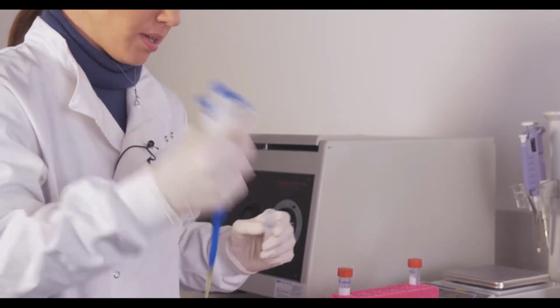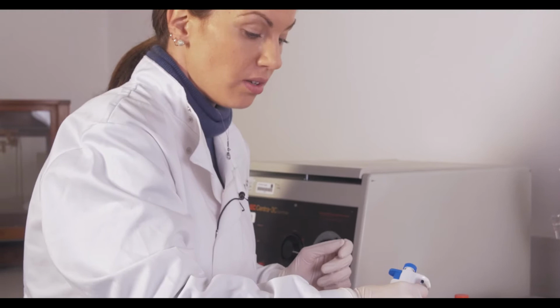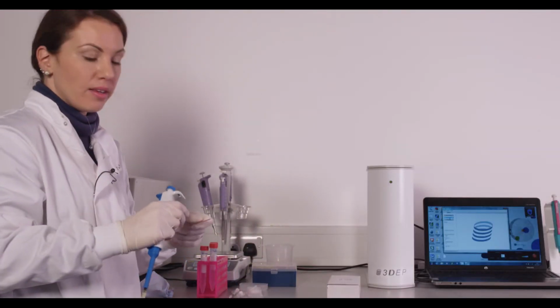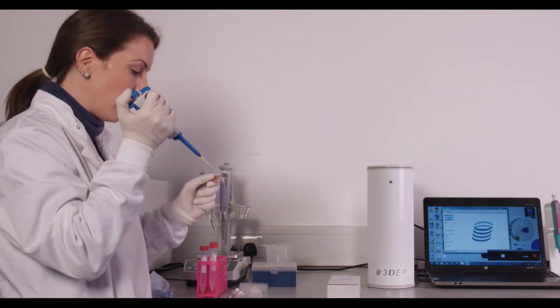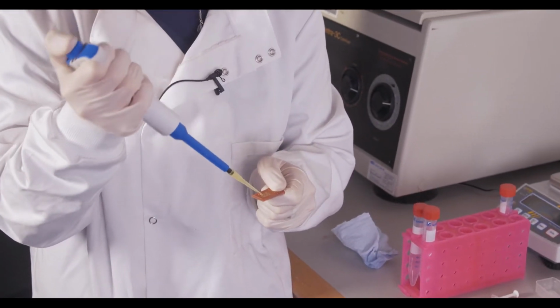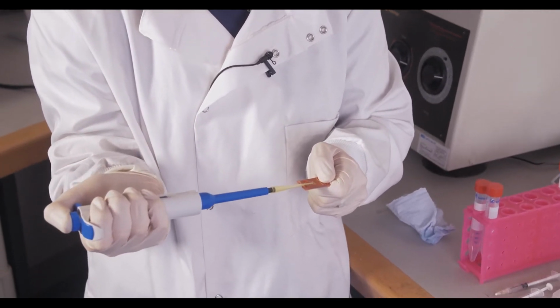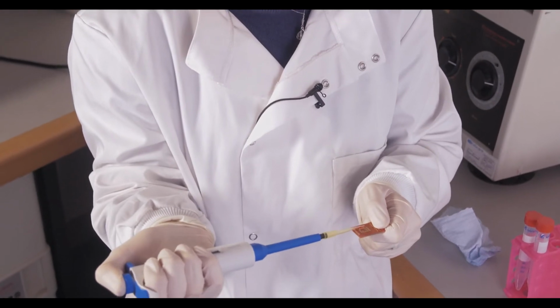So you'll take your cell sample, and in this case I'll demonstrate what you would do if you want to hold the chip. Previously I let the chips lay flat on the table, and in this case you can also keep the chip at an angle and pipette the liquid in that way. Again, you can pick any well that you want. Then you'll just take the pipette tip and again smooth out that meniscus.